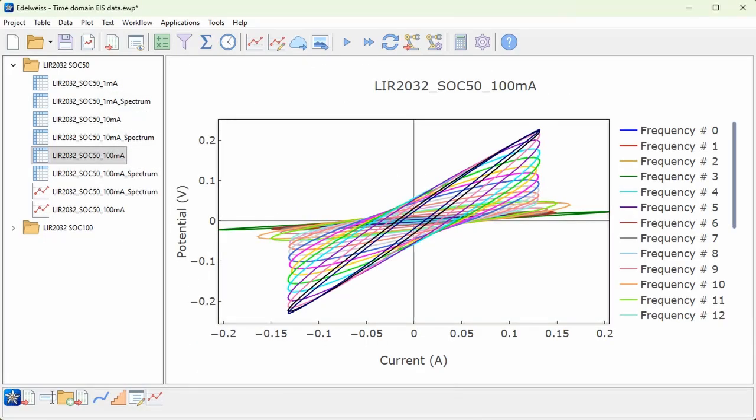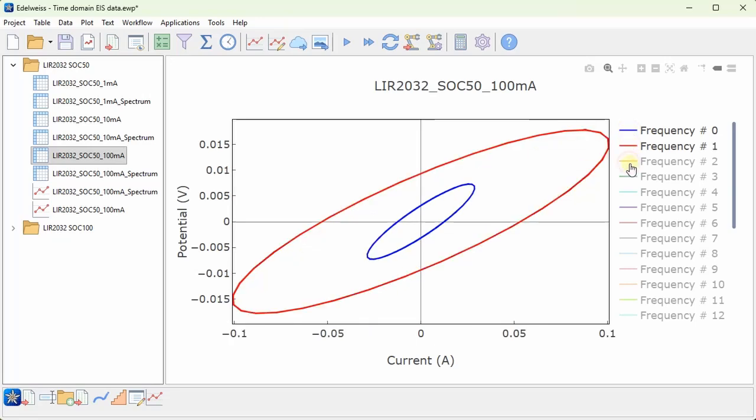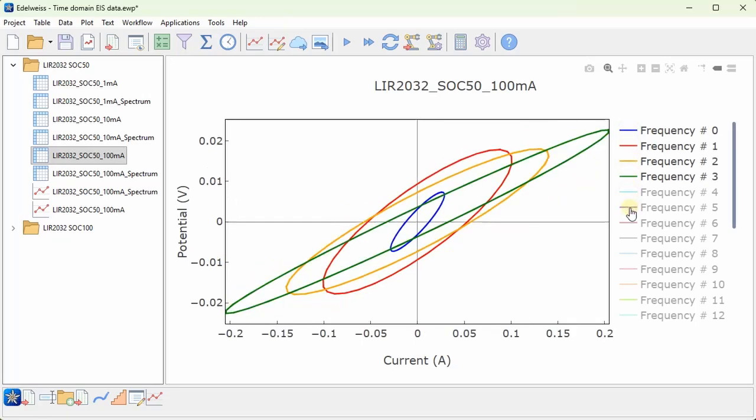Now we see all of this time domain data. If I look at just a few of the traces, these are then Lissajous curves, as you might recognize. And each of them corresponds then to one impedance data point in the Nyquist plot. But this time domain data also contains some more information, and this is what we can get with this process time domain EIS data function.